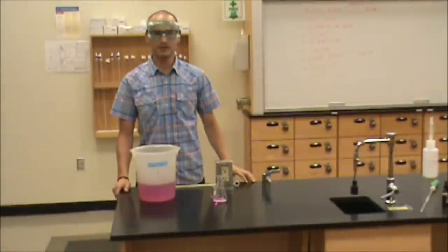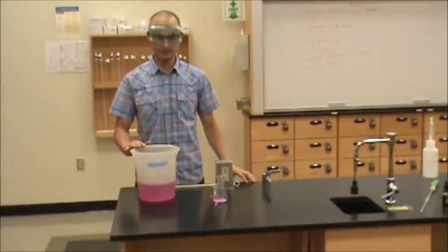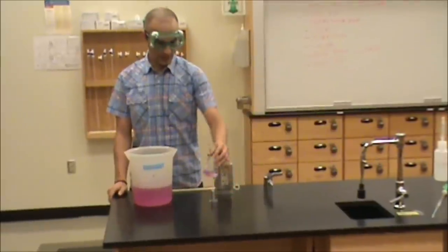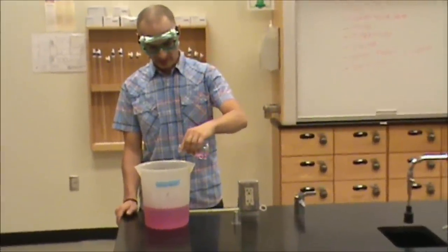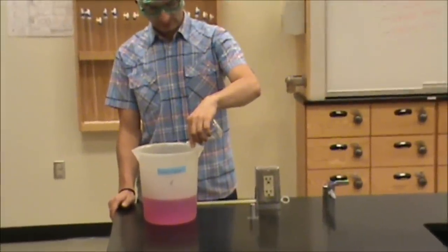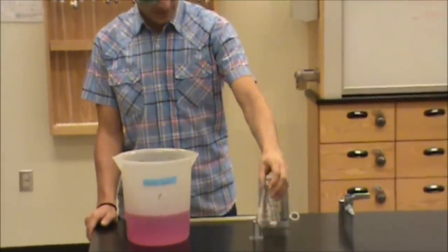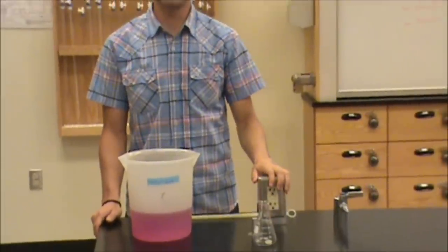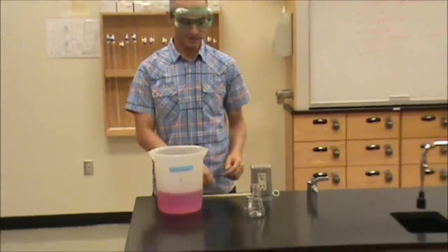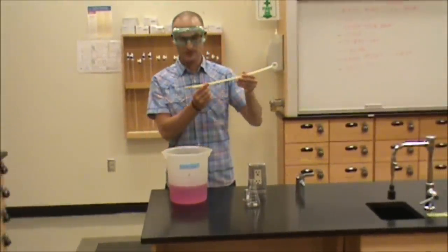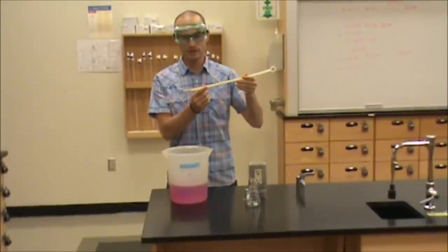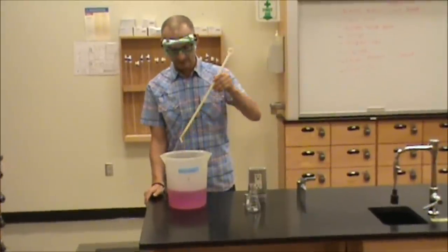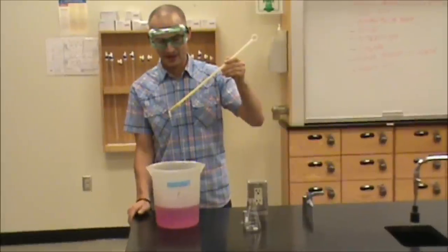Generally, your waste is going to go into a waste container much like this. I'm going to pour our titration waste into the container. And I seem to have dropped my stir bar into the container by accident. Should this happen to you, you can use this magnetic stir wand, generally located by the fume hood, in order to retrieve it quickly and easily from the container.